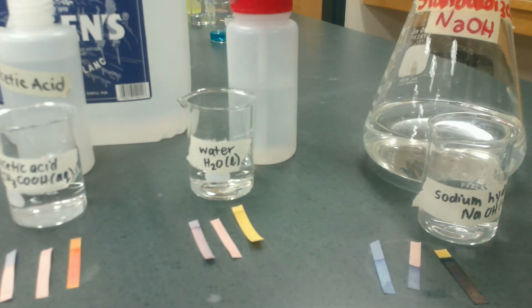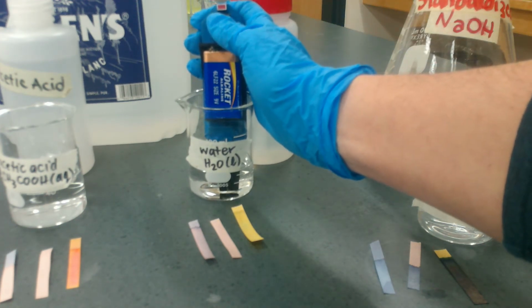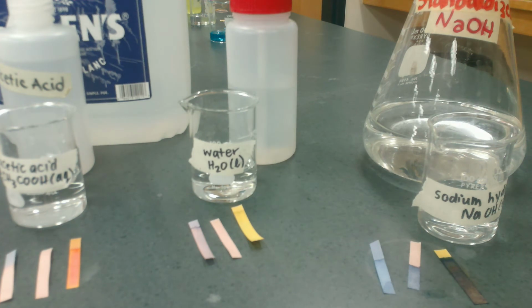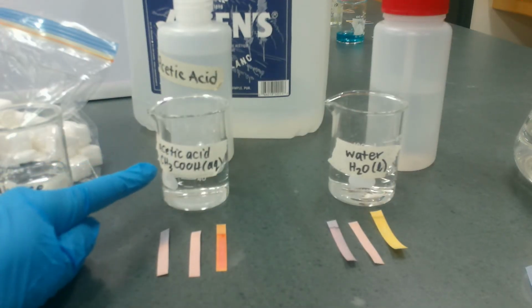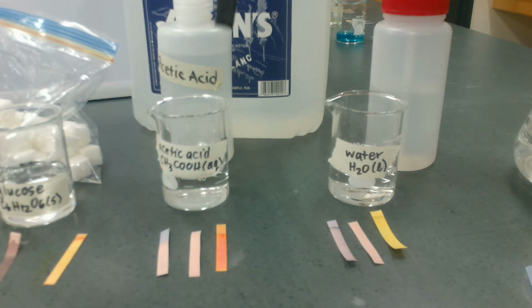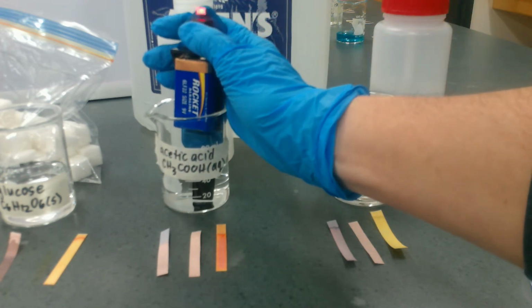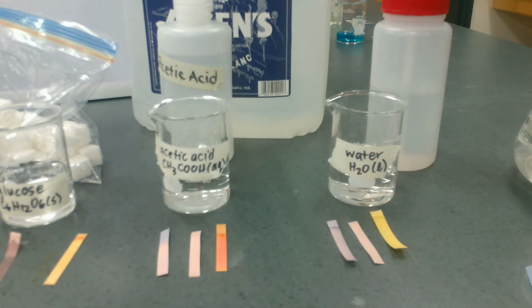Do you think that just plain tap water is going to go ahead and conduct? The light's not coming on. Molecular compounds don't conduct. Why? No metals, no ions. Okay, what about this acid that we have? Well, remember that acids either have an H at the beginning of the formula or, like acetic acid, a COOH ending. And the deal is they have hydrogen ions, and those hydrogen ions are what are going to conduct. So look at that. The light goes on. This is an electrolyte. This solution conducts electricity because of the ions that are present.